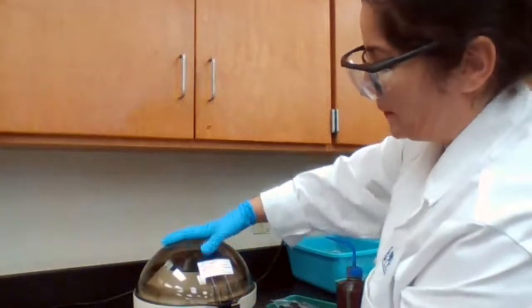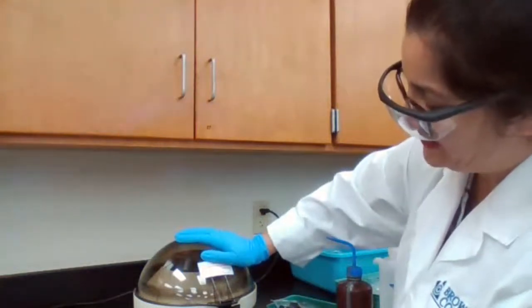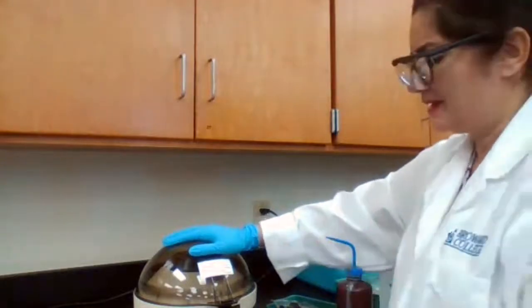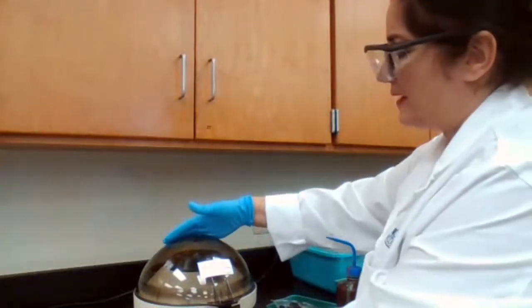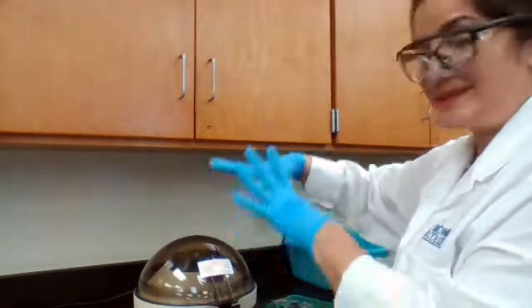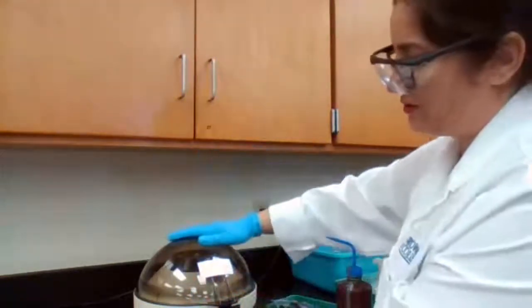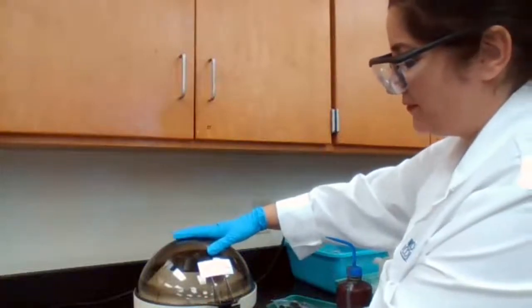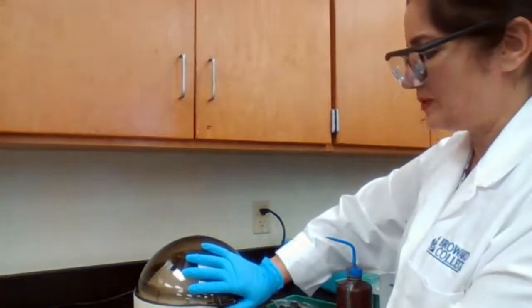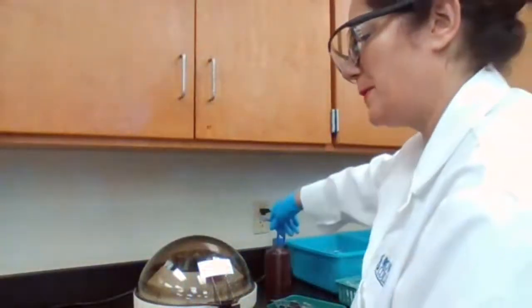and turn it on. Well, this centrifuge, it goes, increments are in minutes. So if I need like 30 seconds, I just have to time it or approximate for 30 seconds and turn it off. If the centrifuge is not balanced, it's going to start moving around. If it's balanced, it will stay still. So it's going to talk to me and say, I'm not balanced. Or if it's balanced, it's going to behave. So I turn it off after 30 seconds, and I take the test tubes out, follow the second part of the experiment, the second step of the experiment.